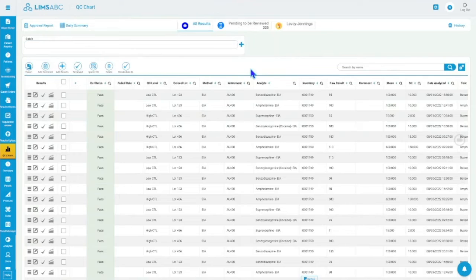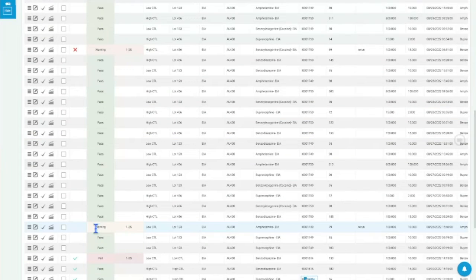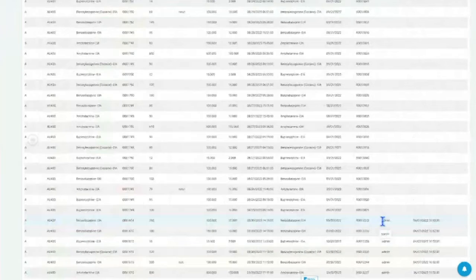But if it's not a batch, let's say it's chemistry, you don't have batches in chemistry, you just have a continuous flow, results keep coming in, then those results will be available in here as well. You can see the results, you can see they passed or they failed, or there is a warning, and you can actually see the last results that were reviewed, right? So in this case, I have these results that had been reviewed, and you can see who reviewed them. We have columns here for who reviewed and when they were reviewed, right? And the review is just a check mark saying, hey, I've looked at these results and they're fine, right?